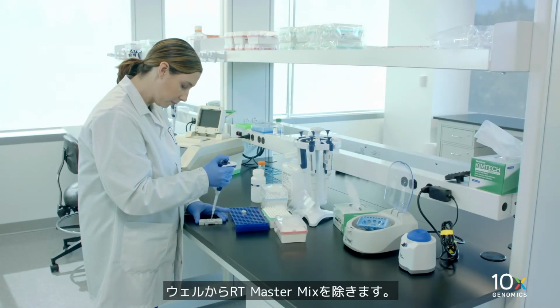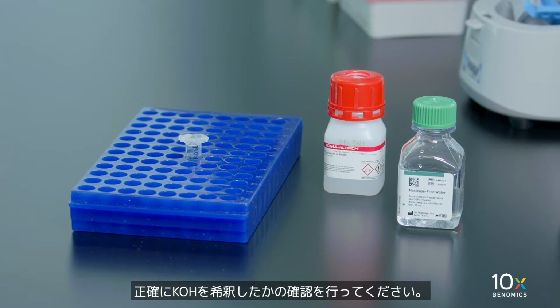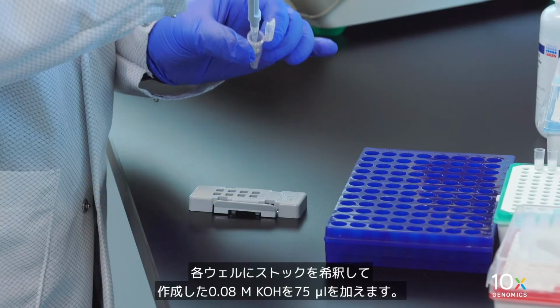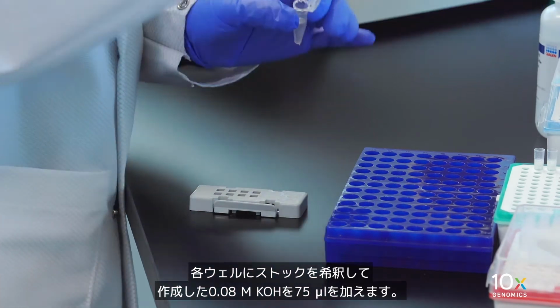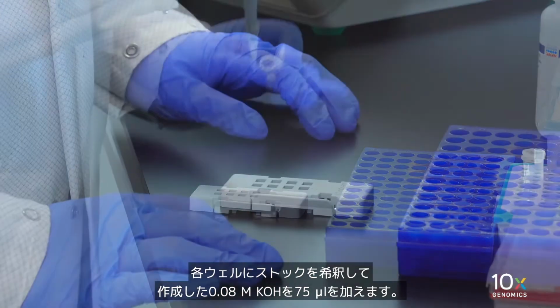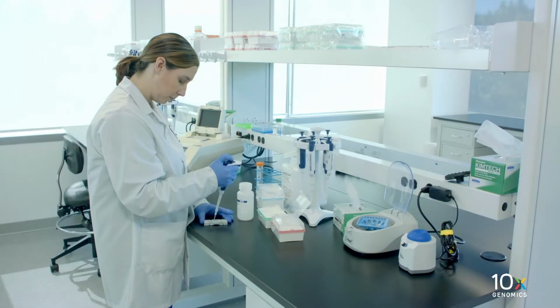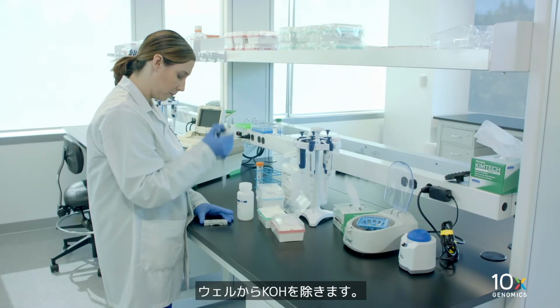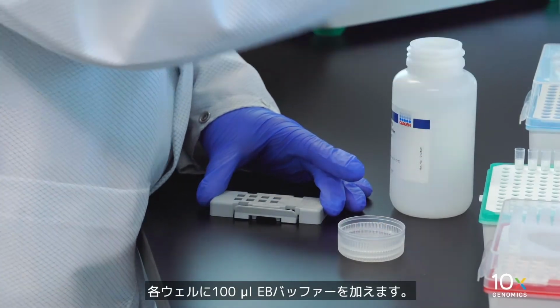Remove RT master mix from the wells. Ensure accurate dilution of the KOH. Add 75 microliters of 0.08 molar KOH diluted from stock to each well. Incubate 5 minutes at room temperature. Remove KOH from the wells. Add 100 microliters buffer EB to each well.